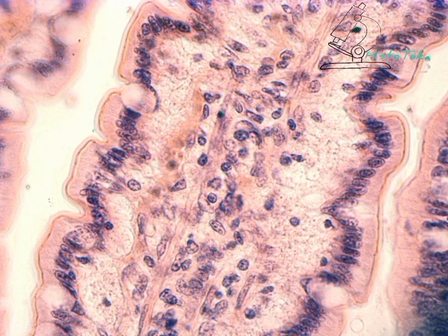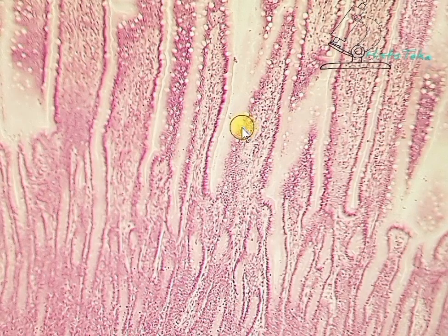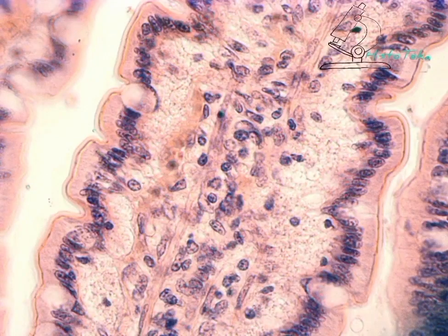Well, in this epithelium, among the columnar epitheliocytes, we see large rounded cells with a light cytoplasm. These are goblet cells. Goblet cells are single glandular cells that secrete a mucus secretion. So, briefly, on this preparation it is necessary to determine a simple columnar absorptive epithelium. In it, columnar epithelial cells, cell nuclei of which lie in one row, goblet cells, and a brush border.